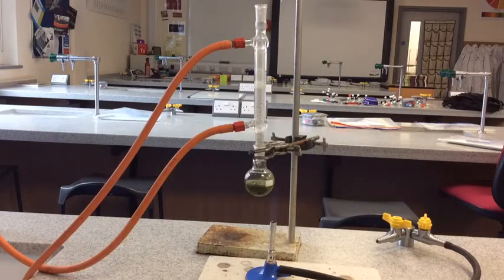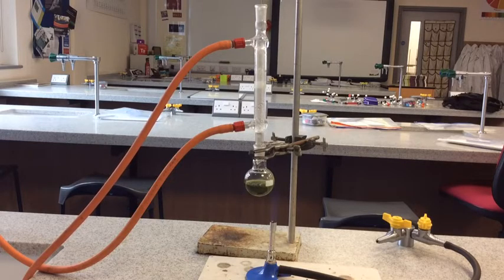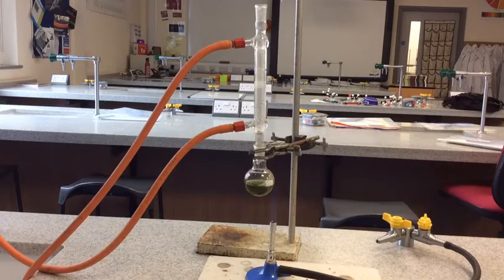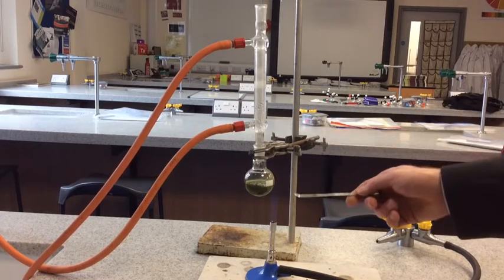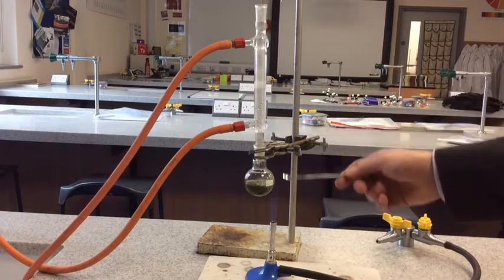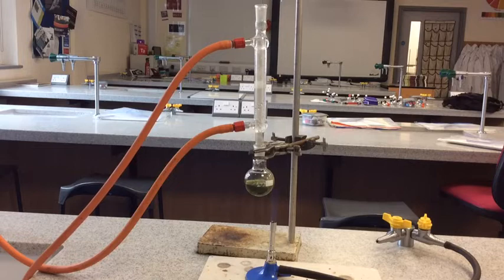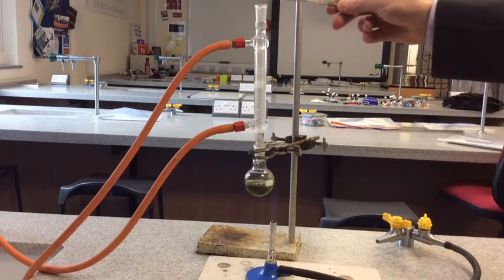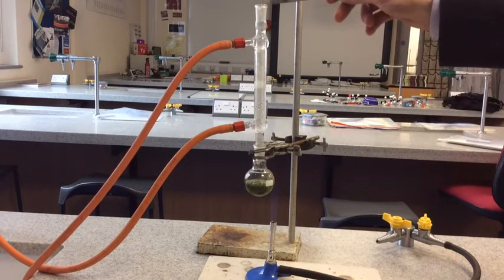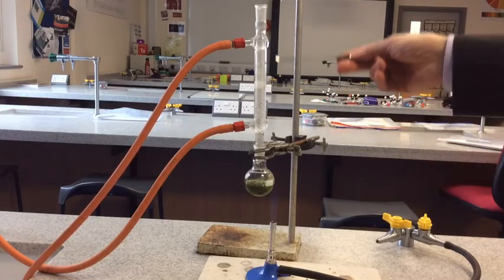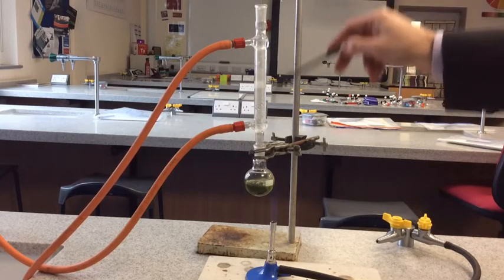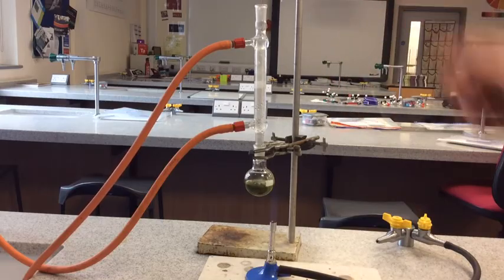By using the reflux position, we generate the second oxidation product, the carboxylic acid. The definition of reflux is the continuous evaporation and condensation of a volatile substance without loss of any product. You can see there the top of the condenser is open, and that's because none of the vapor can escape because it condenses before it gets anywhere near the top there.